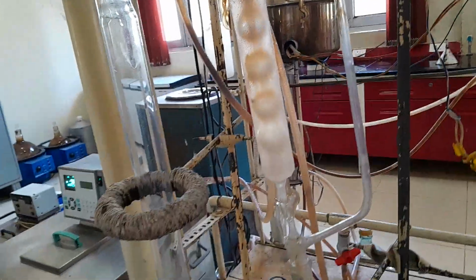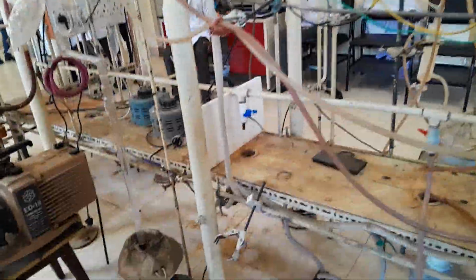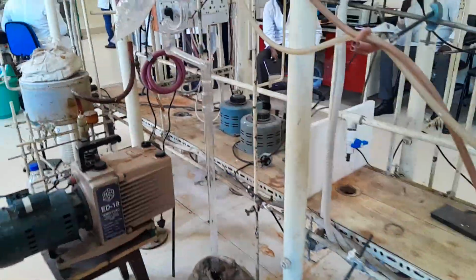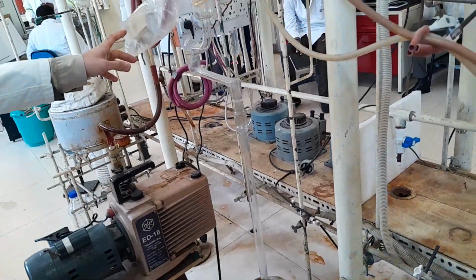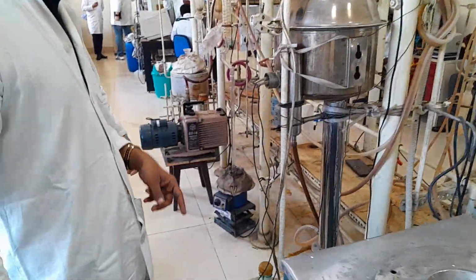Have you also been working with this kind of device? Well, we work with simple distillation units, but not specifically for this kind of application. We would have done it for purification of samples. It's oil, or even a small one. But the same structure. But I want to know, from here, how do they transport this gas to the GC for analysis?